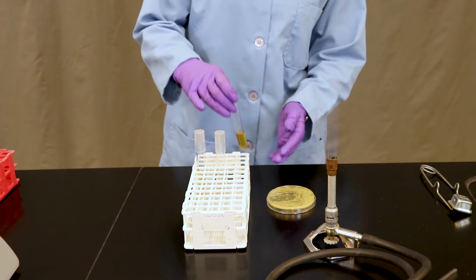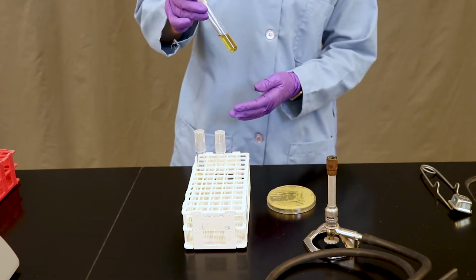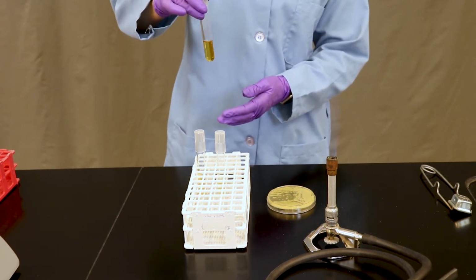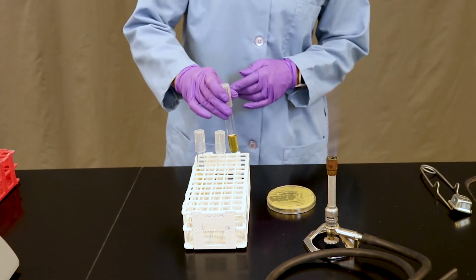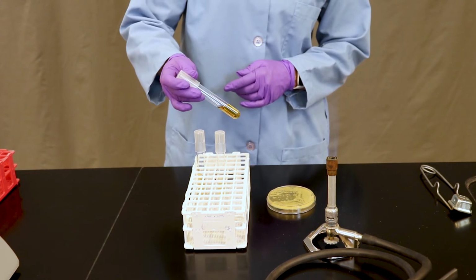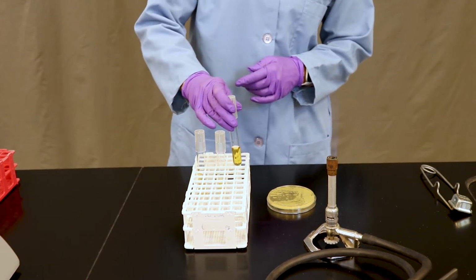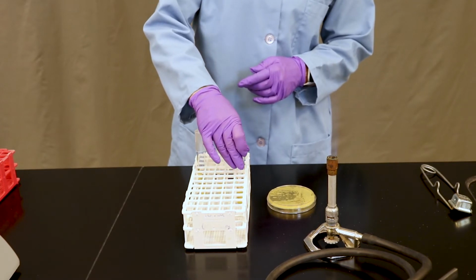The first type of test tube that you will see throughout this course is called a broth. As you can see, this is a liquid culture. It has the same contents that you would essentially find within the Petri plates that we often work with, except it is omitted of the substance called agar, which is the solidifying medium.